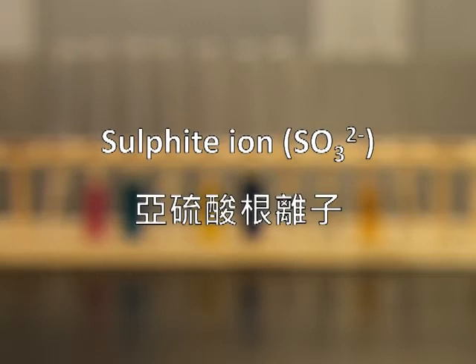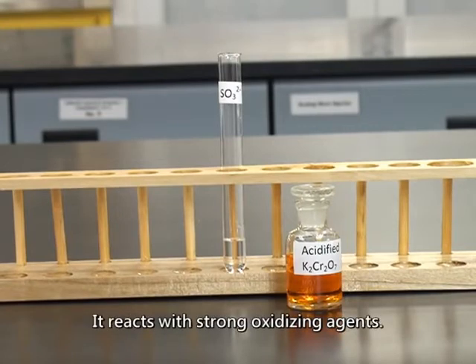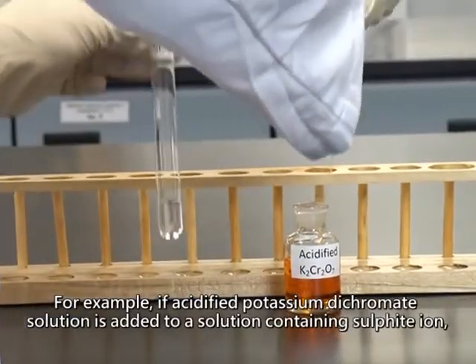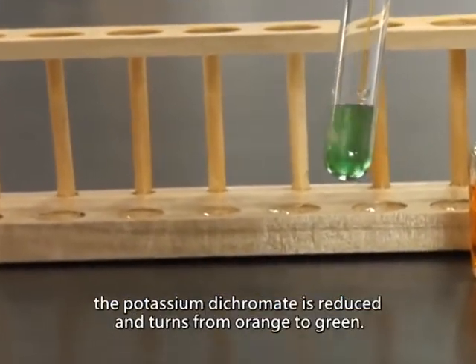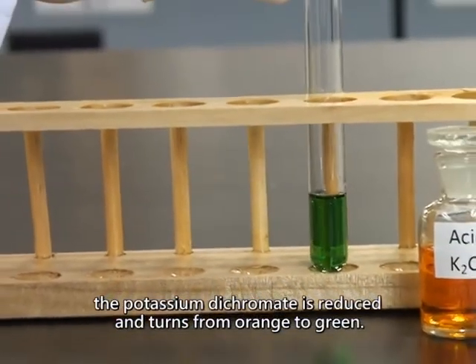Sulfite ion. Sulfite ion has reducing power. It reacts with strong oxidizing agents. For example, if acidified potassium dichromate solution is added to a solution containing sulfite ion, the potassium dichromate is reduced and turns from orange to green.